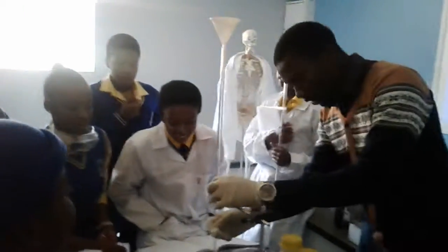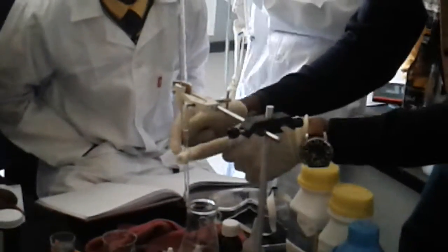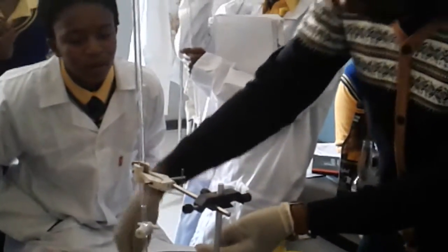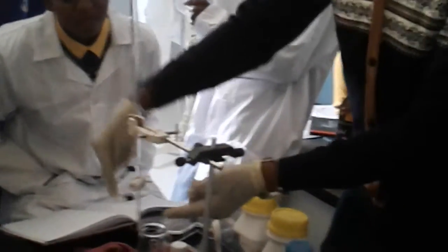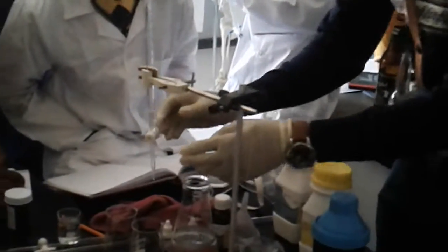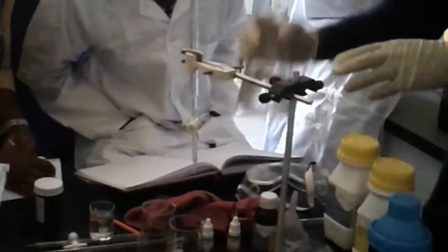Okay. So how do you work this thing? Yeah, it has a hole. It allows the thing to go through. Right? Very smooth, guys. We need accurate results here. Okay, and then it's doing something. Right? So now I'm gonna clean it.